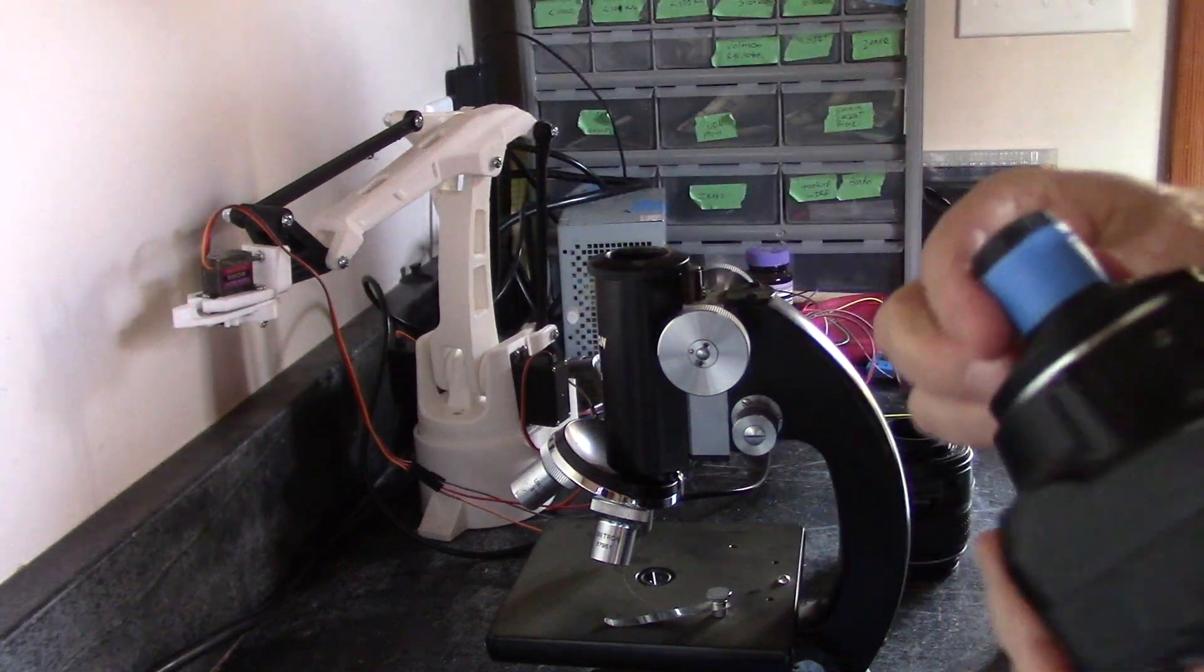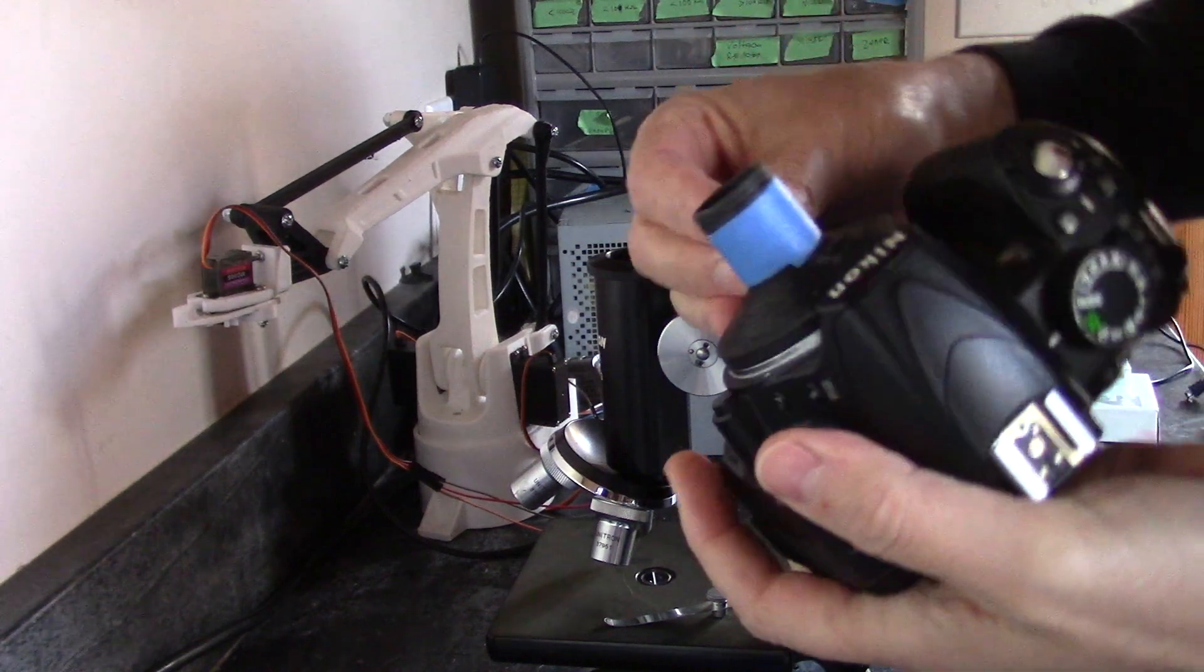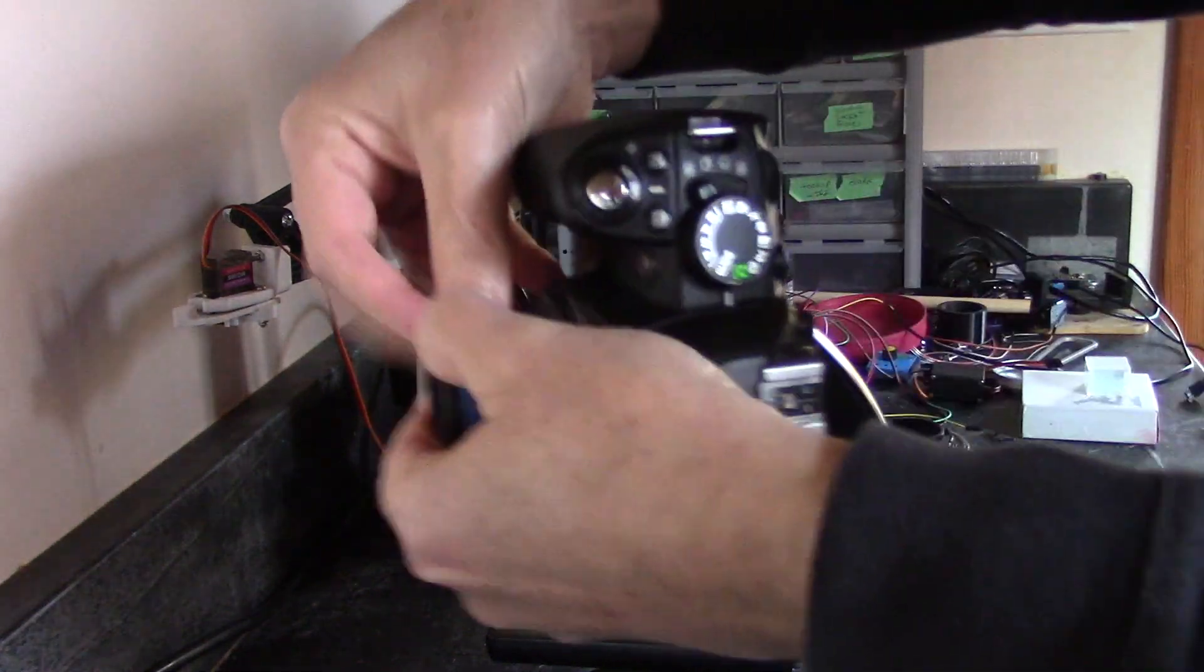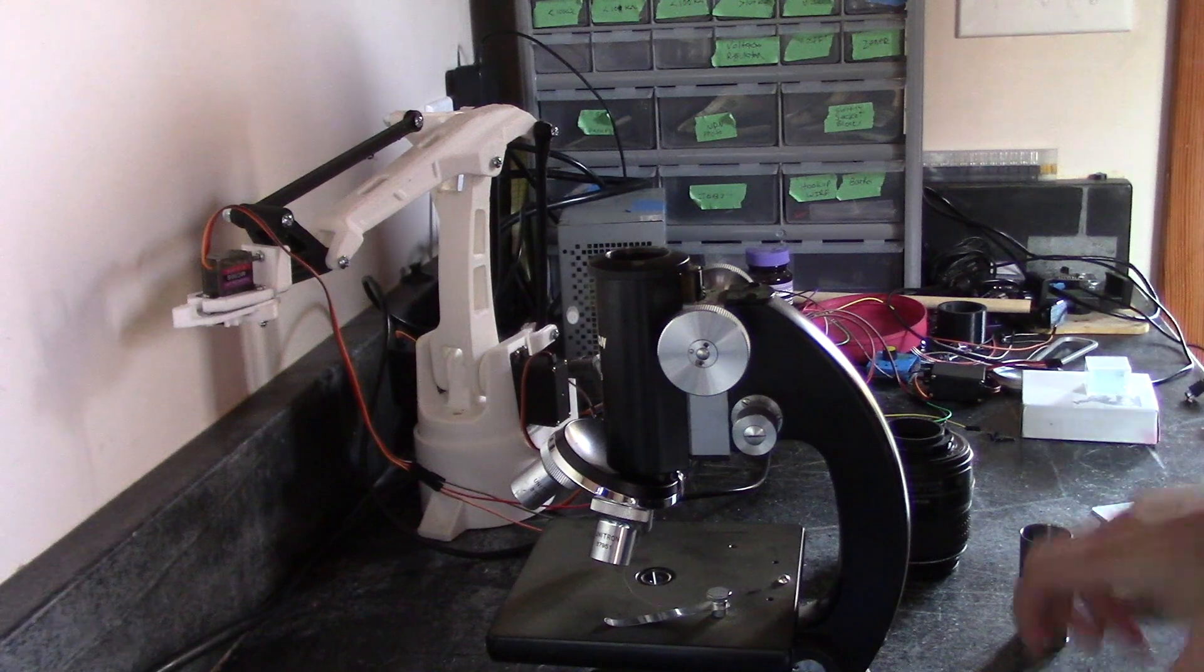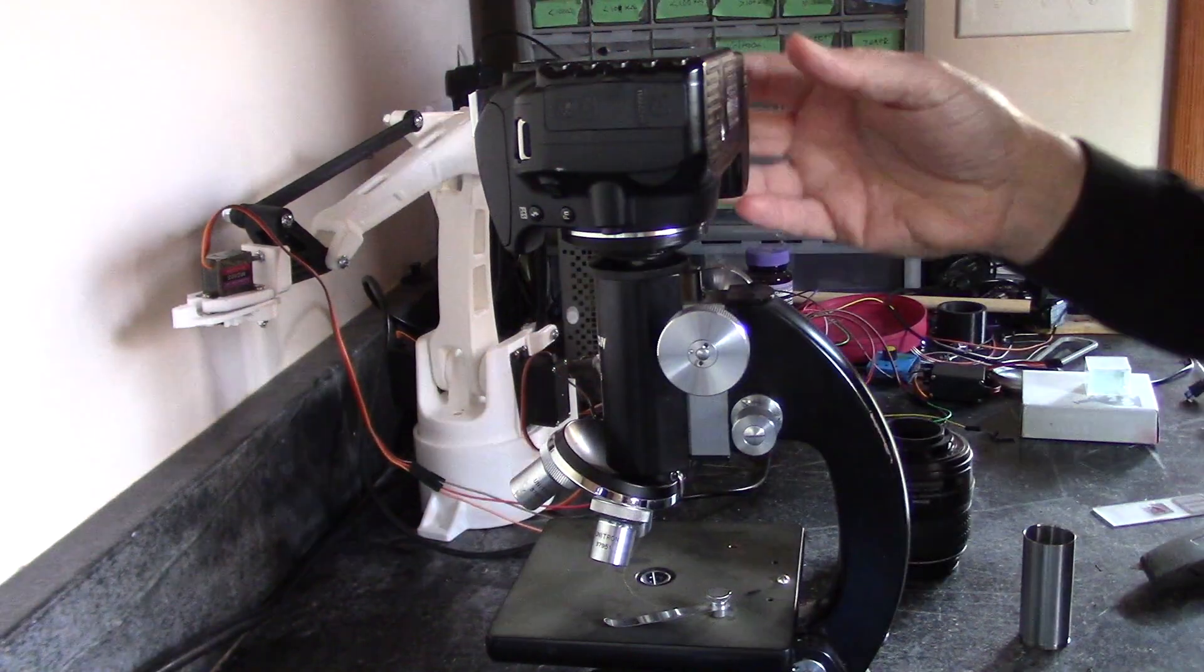It's actually too much, okay. Okay, no problem. Just back that off a little bit until I can get the slack out. Okay, there we go. Perfect. Well, now that works just fine.